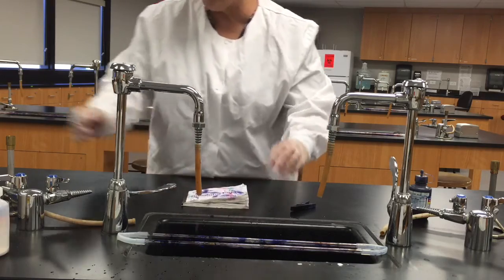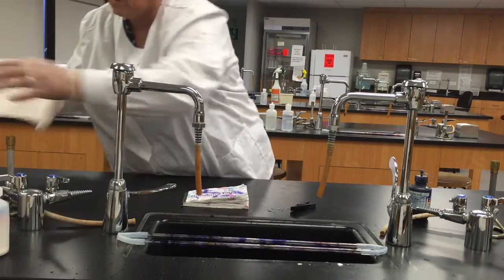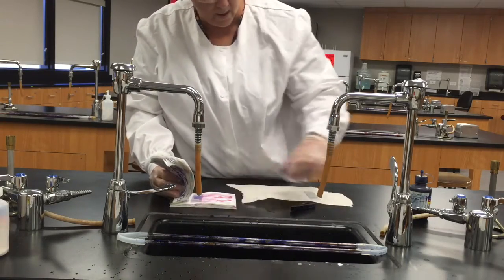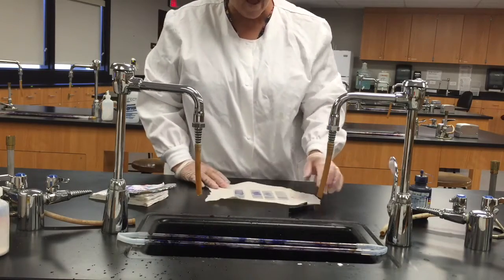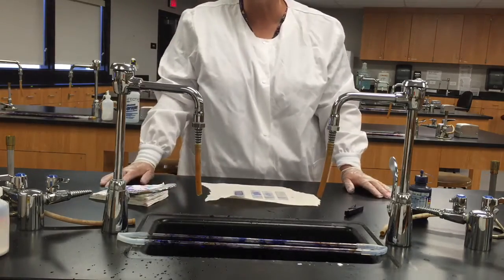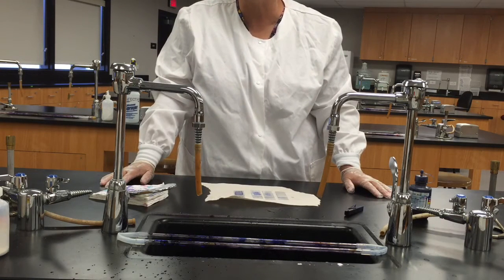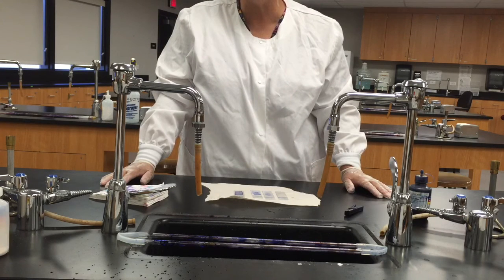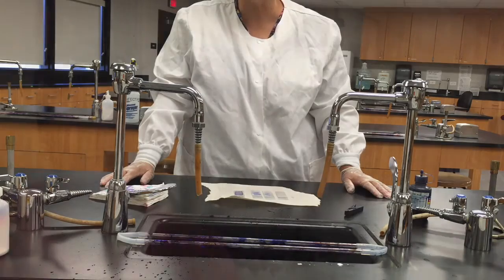Okay, now they may not be completely dry at this point, so I'll just get me a little piece of paper toweling here and lay them down. If you want to at this point, you could put them back on the slide dryer for a couple of minutes. Once they've completely dried, then we're ready to look at them with the microscope. So I'm going to break again and we'll be back in a couple of minutes to take a look at the results of our staining efforts.